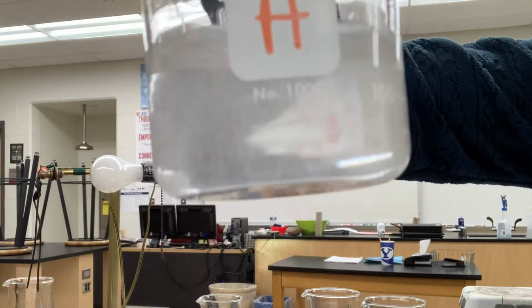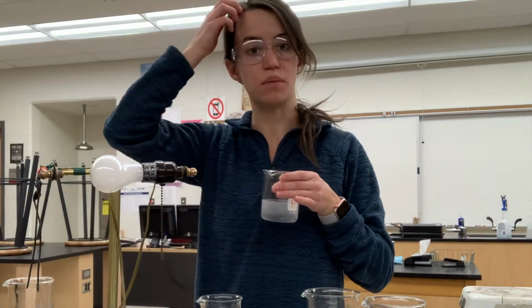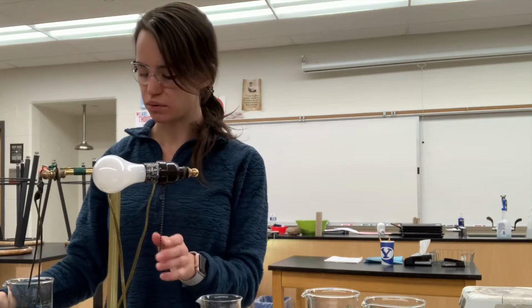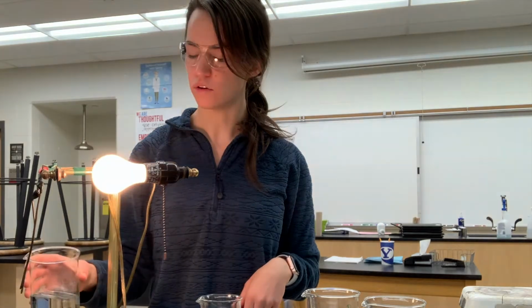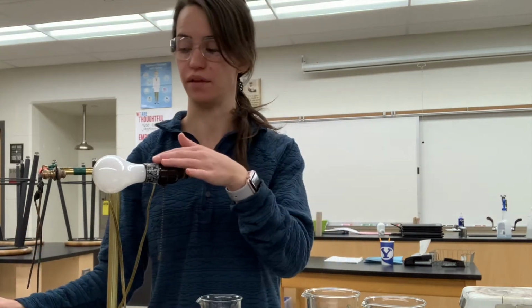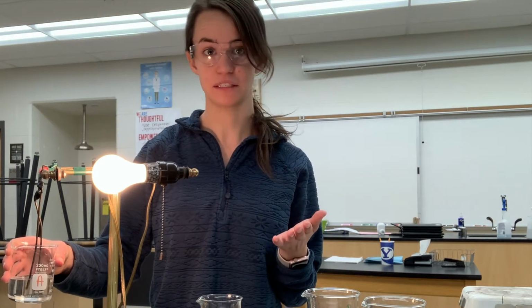All right, next we're gonna do a conductivity test. We're gonna take this water and see if it will light up this light bulb. We're gonna submerge these two prongs over here to make the light bulb light up. If you just touch the prongs together, like this, you'll notice the light bulb lights up. But when they're not touched, it doesn't. So if it's an ionic substance, it's gonna allow the particles to move back and forth and light up the light bulb, okay? So let's see if this one will make it light up or not. All right, record your observations about conductivity.